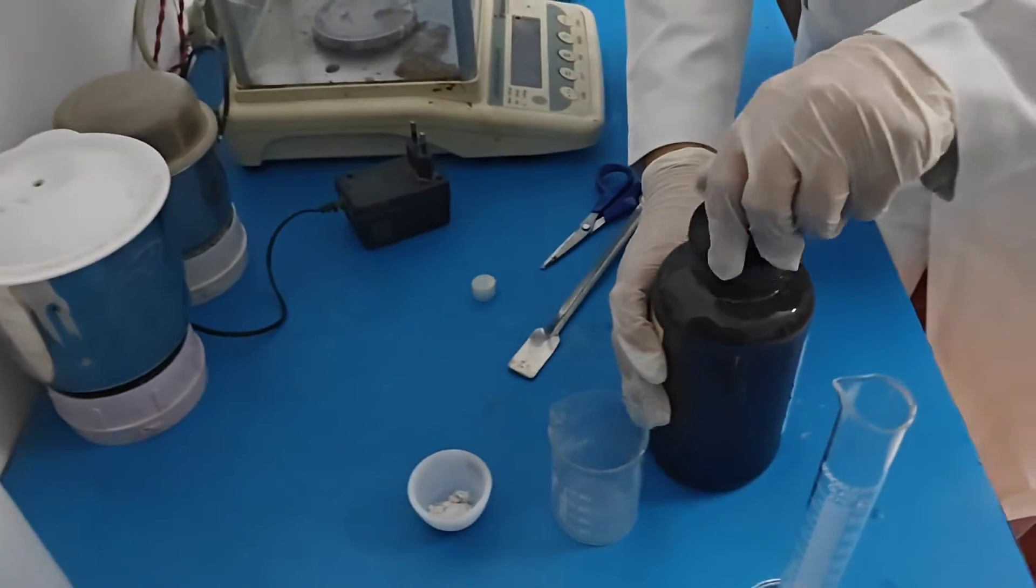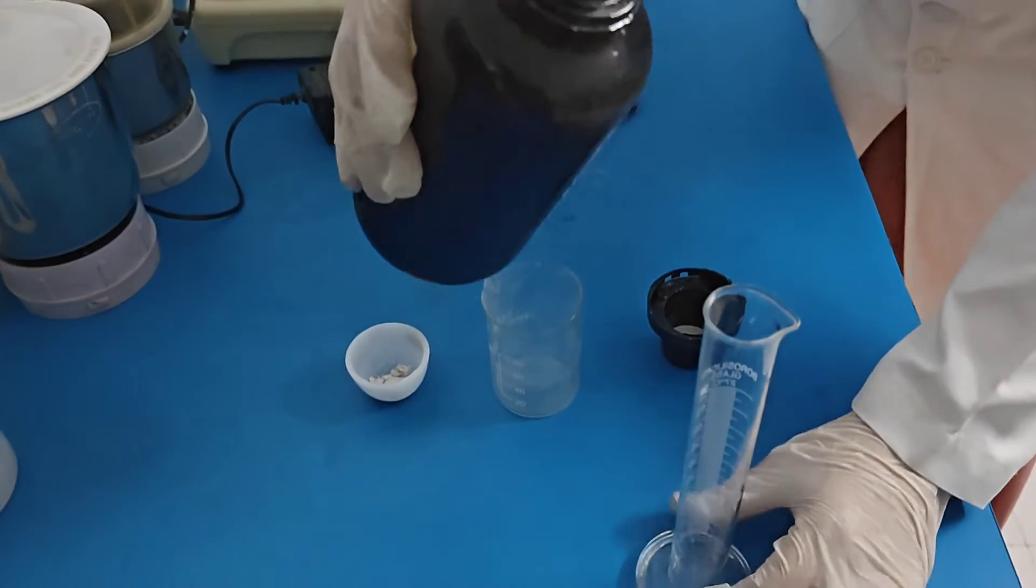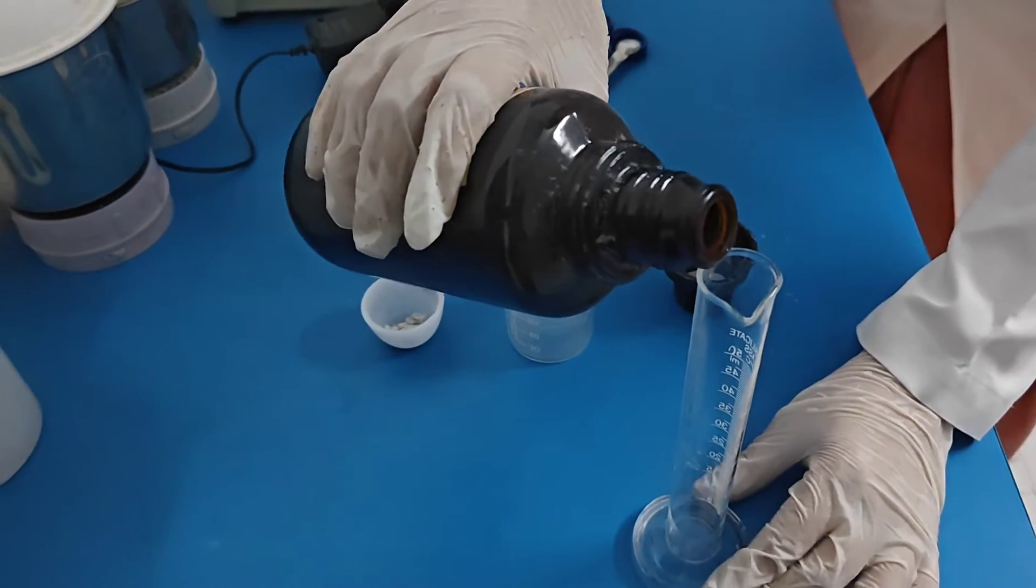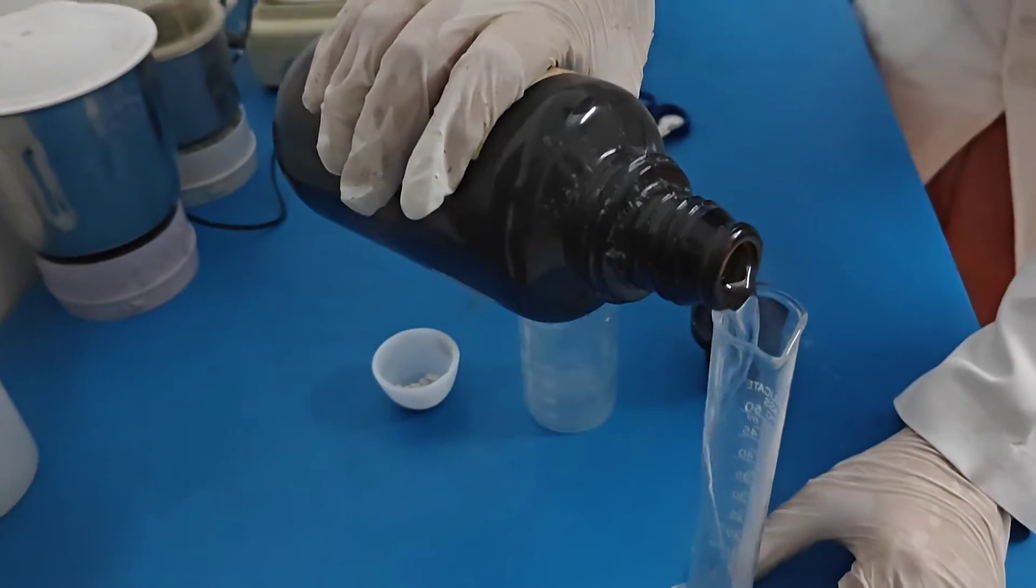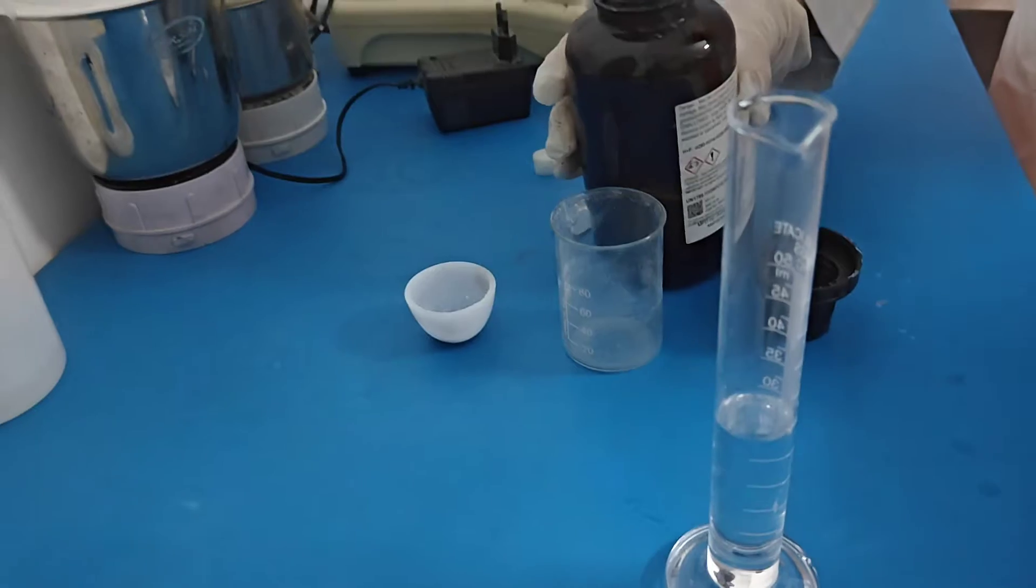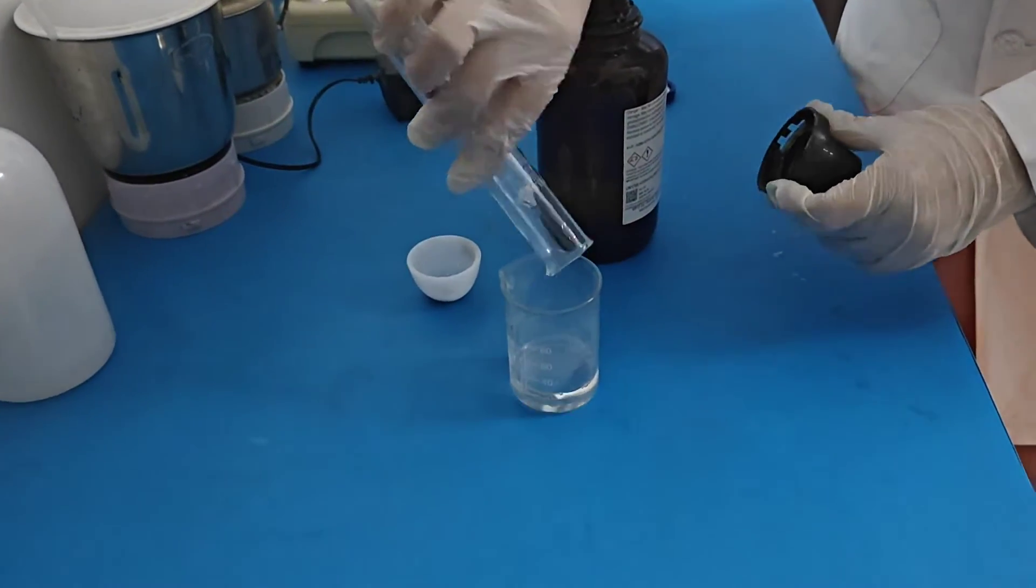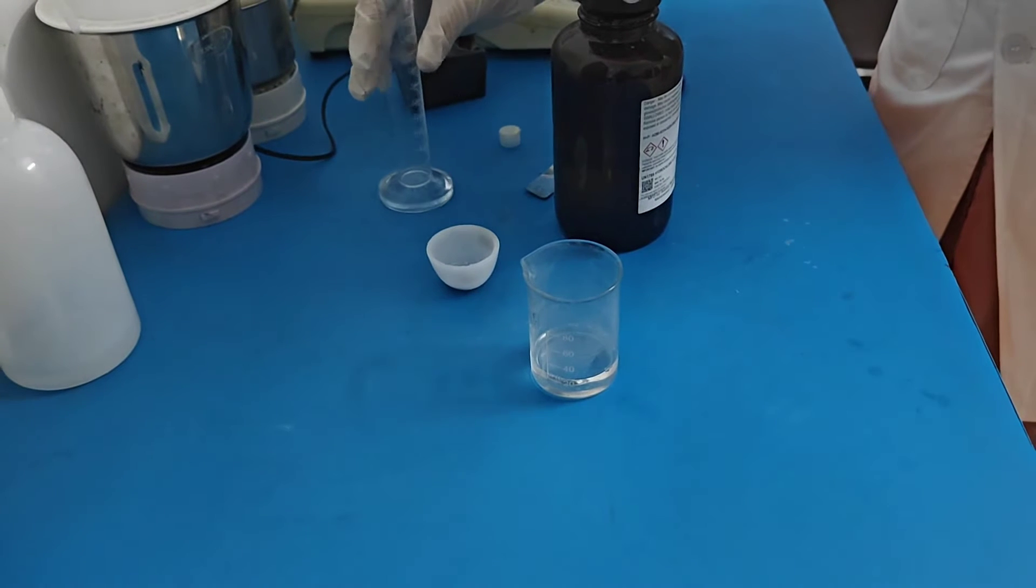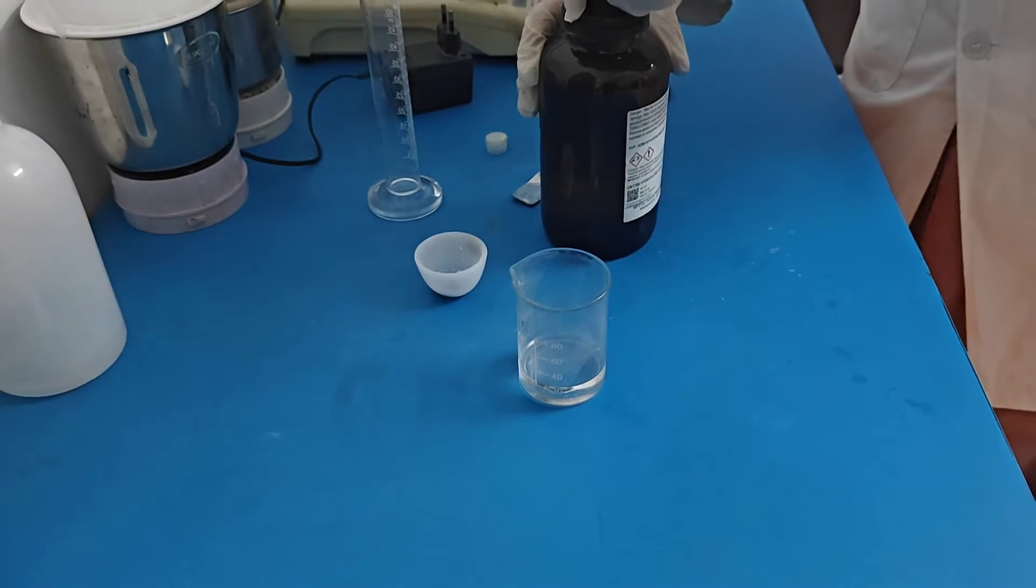Now I am going to measure the concentrated HCl 25 ml. Handle the concentrated HCl very carefully because it is hazardous.